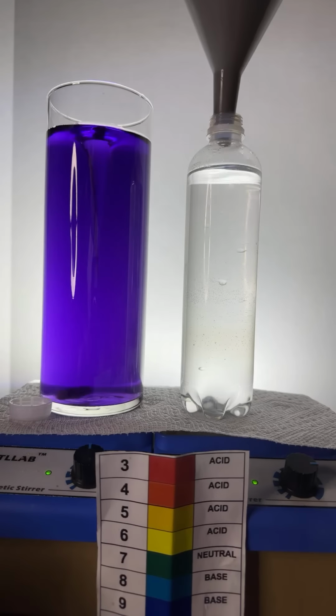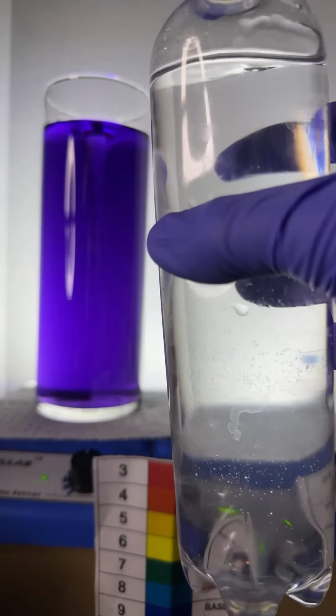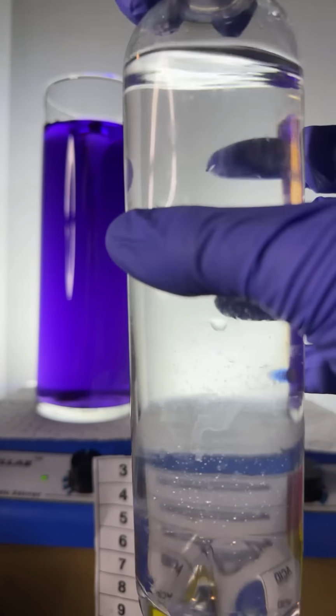All right? Okay, now, I've got my acetone there. Let's take this out. Let's mix it up. We're going to go ahead and mix this up. We got to get the lid so I can do that. Where the heck is the lid to my bottles? Here we go. We'll just use this one. Oh, here it is. I put it right over here. Let me see. I'm going to read a couple comments here. All right, here we go.